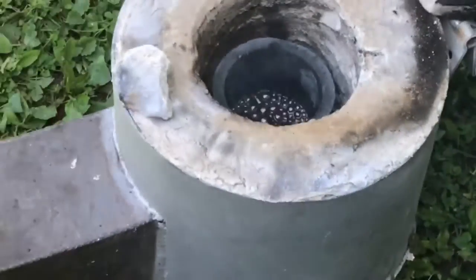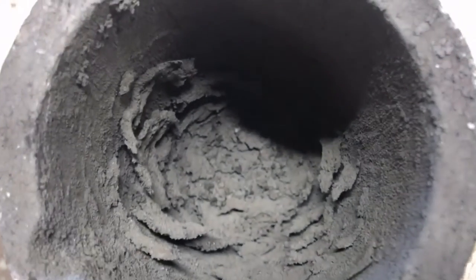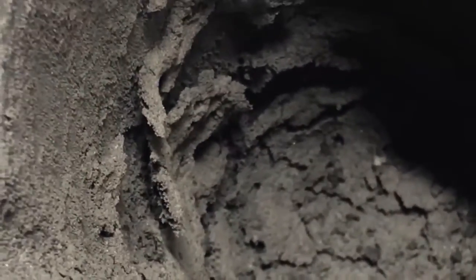That is the orange liquid — you can kind of see its orange tinge — and that's what happens once all the water has boiled out. I did have a lid on that. This is what it looks like when it's done after being baked at 550°C.